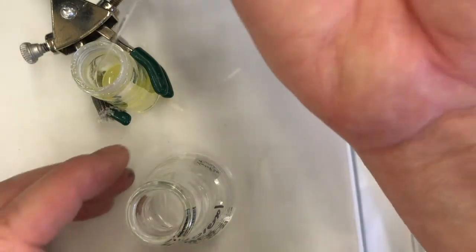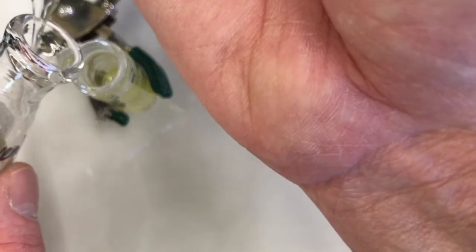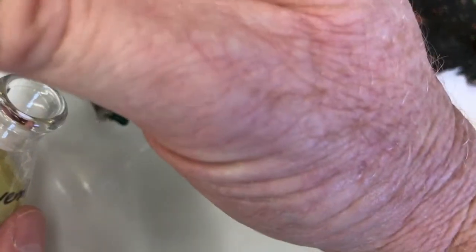All right, so let me pipette that over. I'll suck up some of my reaction, push it back out, suck it back up, and put it into my flask. It's dripping a little bit, but I got it. Since this is such a small scale reaction in the microscale glassware, this conical vial, I'm going to use a pipette to get it out. It's better than pouring, I think. And it'll be easy for me to leave the stir bar behind.